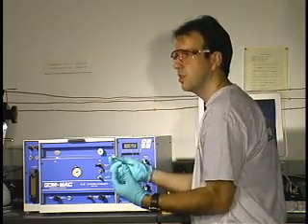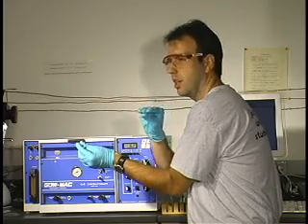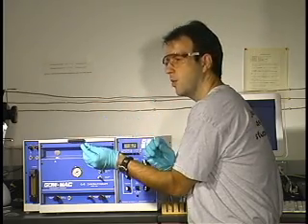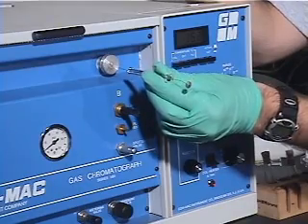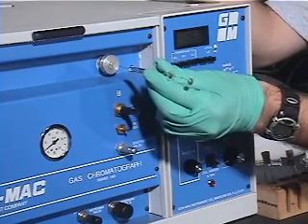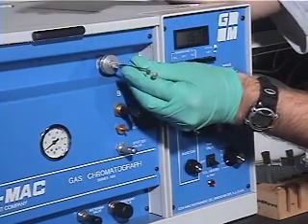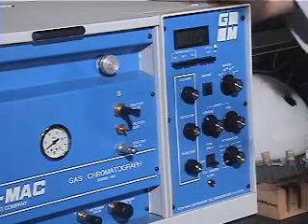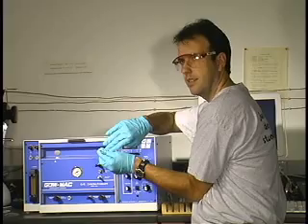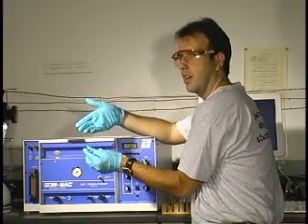The third source of confusion is that this is not a very straightforward procedure. When you inject your sample through the septum, you push it in and push the plunger in, but a lot of people will tend to leave the syringe in the instrument. You don't want to leave it in the instrument — you want to pull it out as soon as you push the plunger in. One smooth motion will give you the best results.